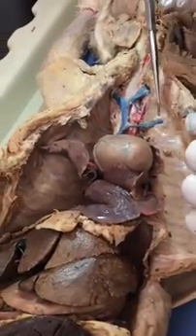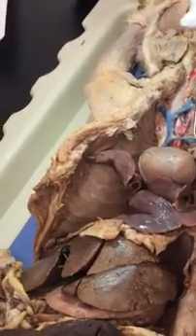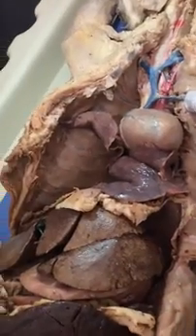See, you can see where yours broke. So you would only use one that's still attached. I would prefer to, yes. But if I can't, then I'd pull it like this and pin it that way, to the chest wall, so you can see that I'm talking about that one.